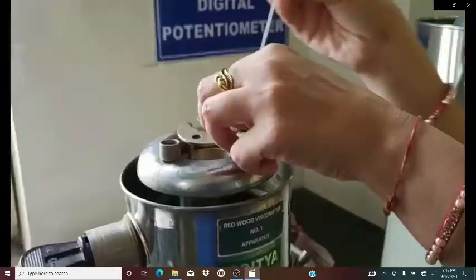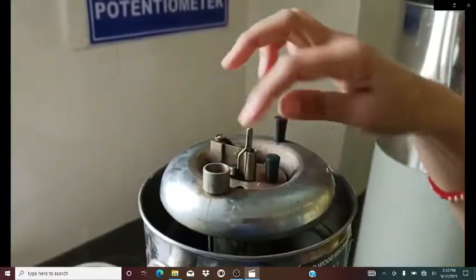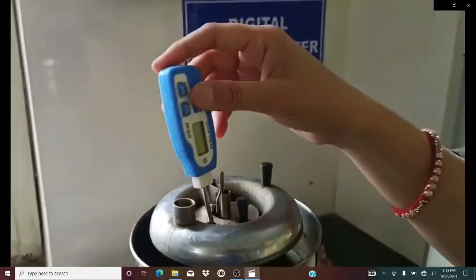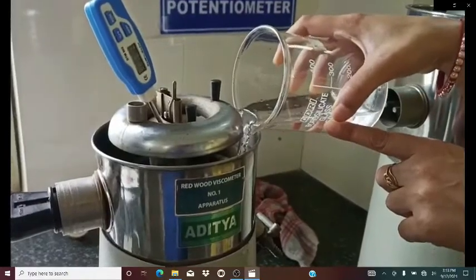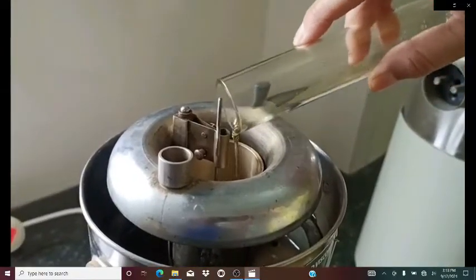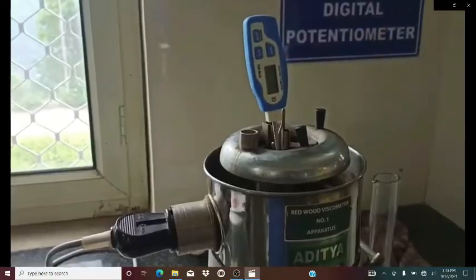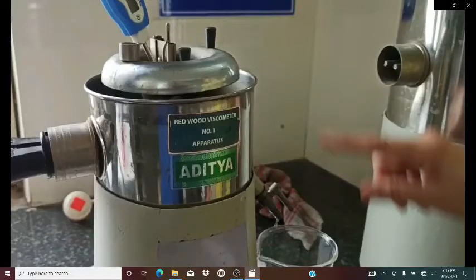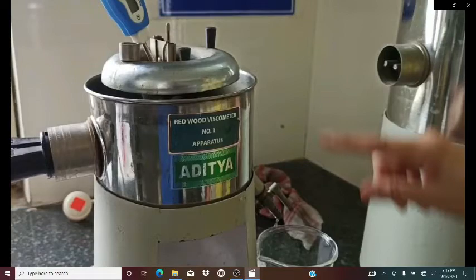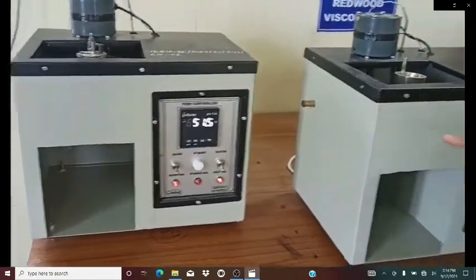The mechanical stirrer is used for uniform heating of the water. In the outer vessel we put water which is heated up, and here is the lubricating oil which is filled into this cylindrical vessel. Now cover it with the lid. Here is the temperature. After completing the experiment you need to drain out the water from the outer vessel so that your instrument has a longer life.